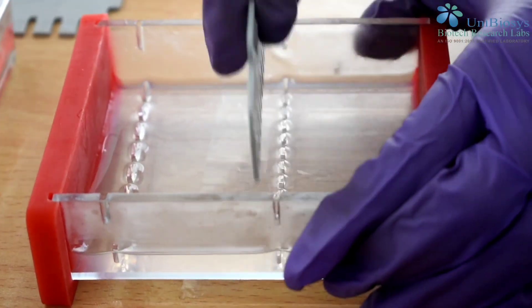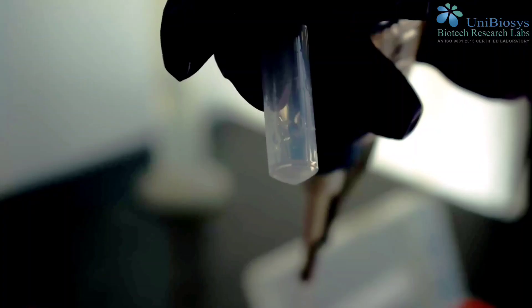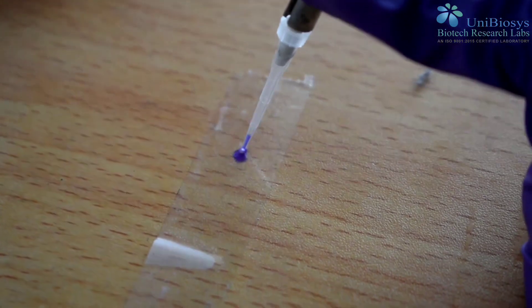For analyzing the DNA, sample is mixed with a drop of loading dye and loaded in the gel.